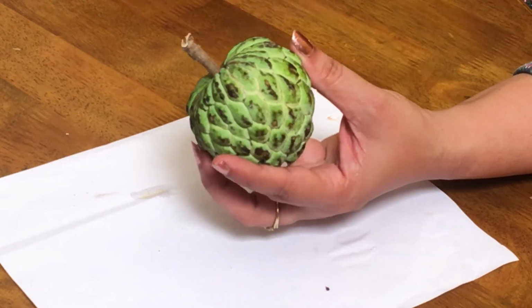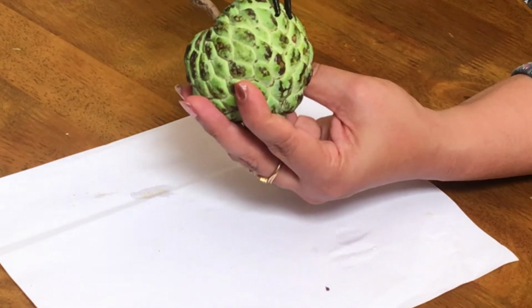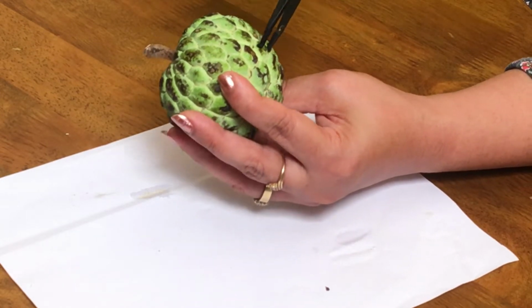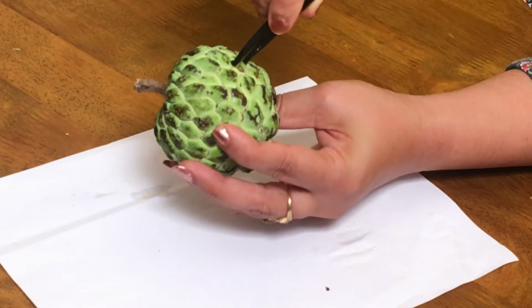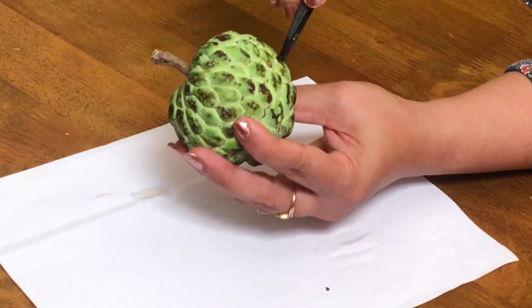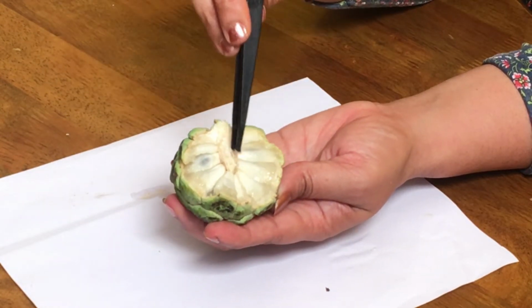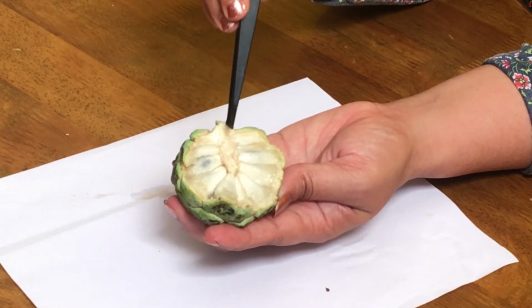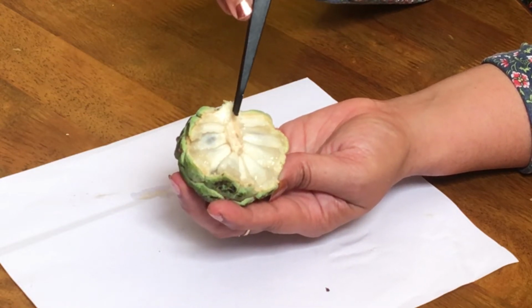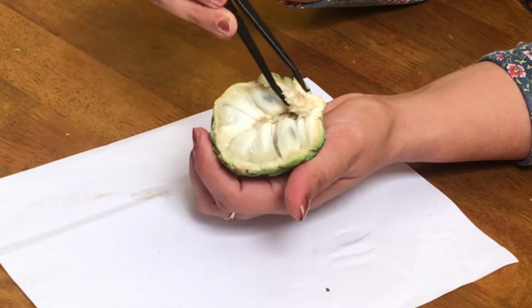And each of these sections, polygonal sections that you can see here, these are all called fruitlets. This is one fruitlet, second fruitlet, third fruitlet, like that. So if you cut open like this, you will be able to find a tiny fruit inside. So each section is actually a representation of a fruitlet inside. See, look at this. What is this? This is the thalamus part. Stalk was here, and this is the thalamus part, which has enlarged into a conical shaped structure which is non-edible.